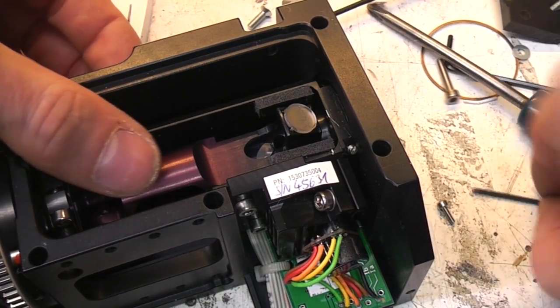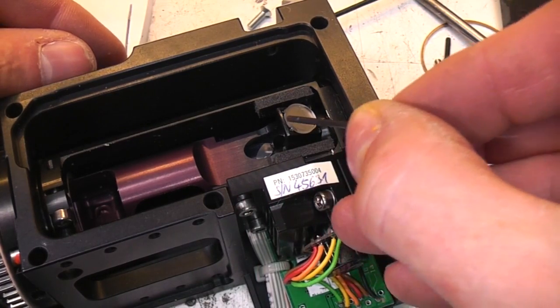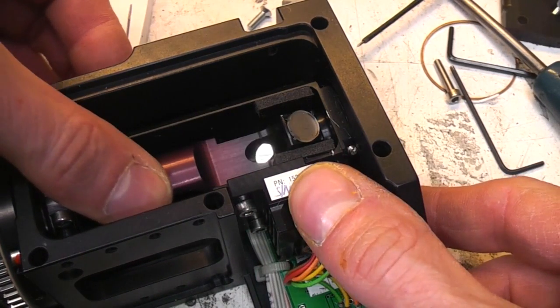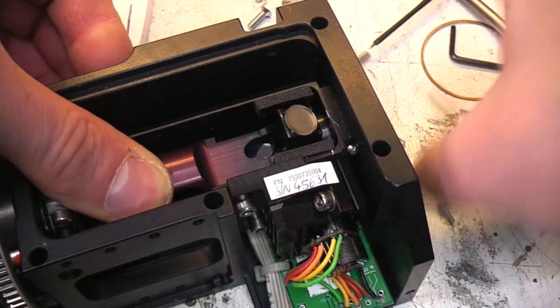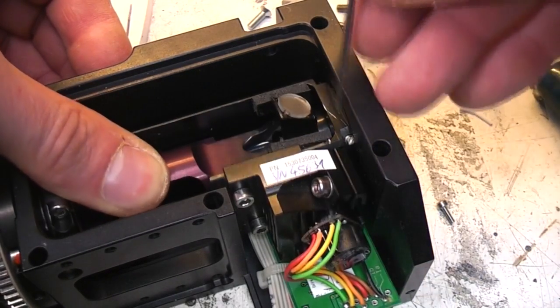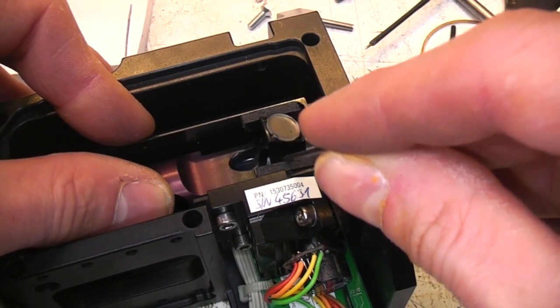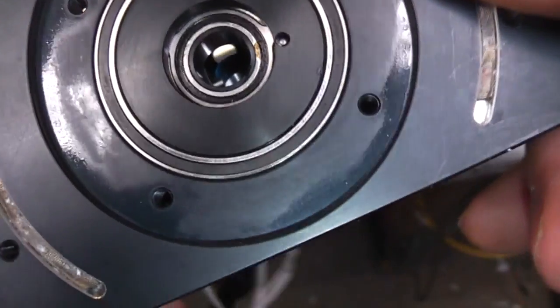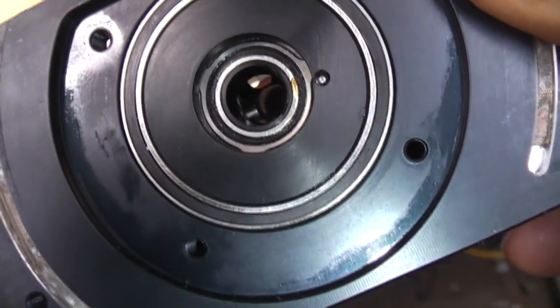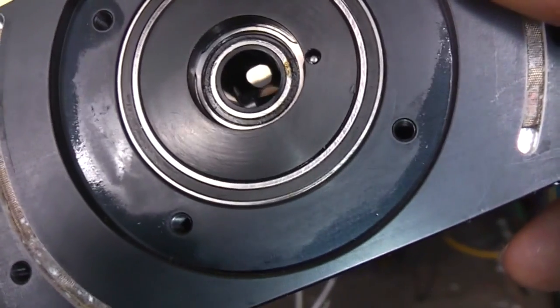So looking at the actual light path in here, the beam comes in here horizontally, hits this mirror and then this mirror, and if you look at the way these are mounted, these are both mounted on this central section. So this is now swinging the beam that way, and then that directs it onto the small galvanometer motor, which is right under here in the centre. And then if I just rotate the body of this galv, you can see that's basically lined up directly with the output.